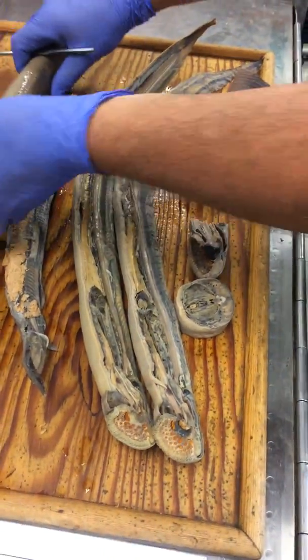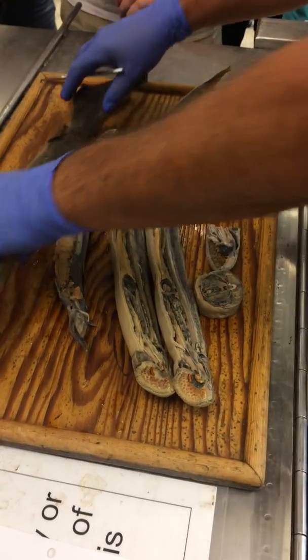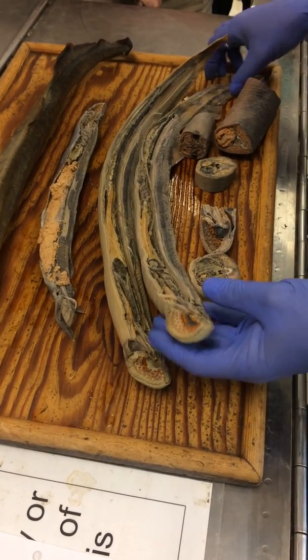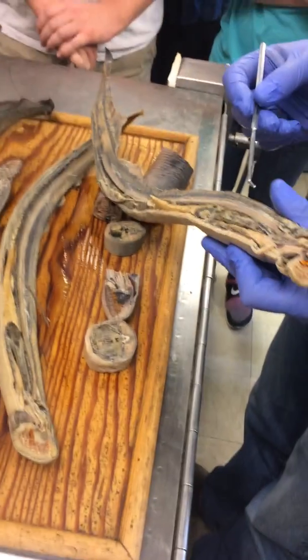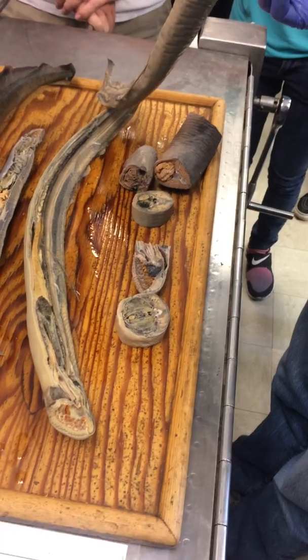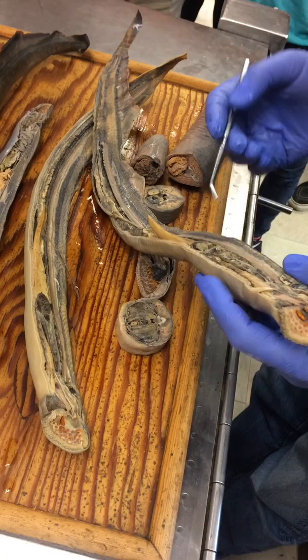I think that's pretty much it for the outside of this guy — oh, and the eyes. I forgot to mention there's eyes. So if we look at a sagittal section, there's this long, stiff but flexible rod running along the back of the animal, and that would be the notochord. That's the notochord.